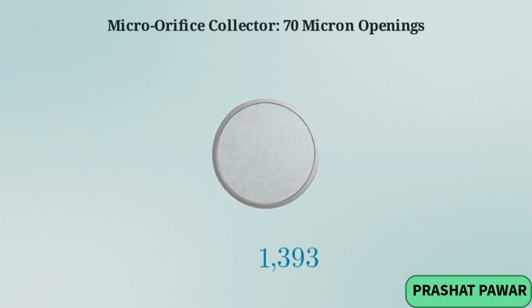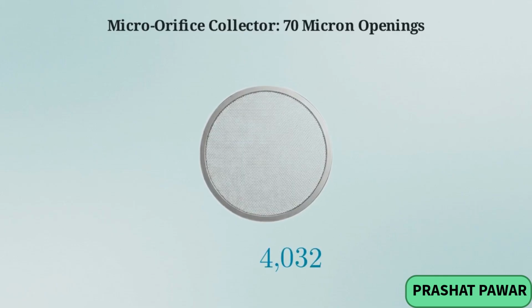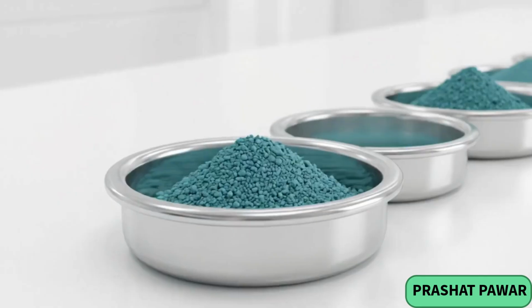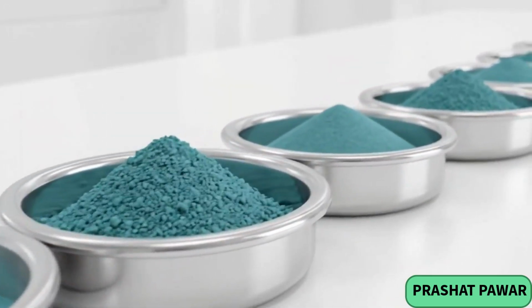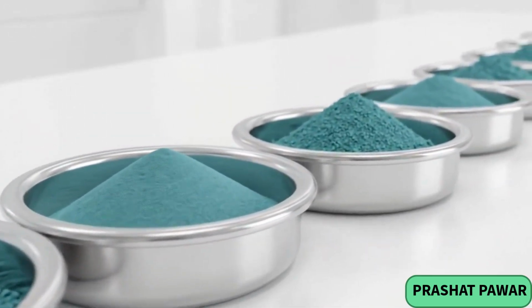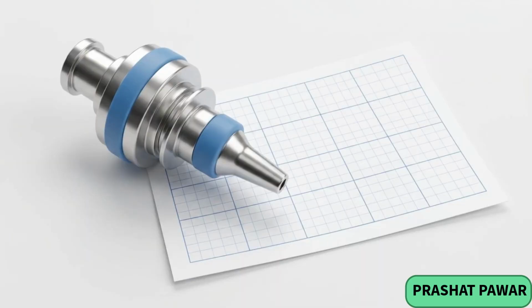The sequence ends at the micro-orifice collector, which acts as a final physical filter, utilizing over 4,000 holes measuring a mere 70 microns across. The result of this engineered matrix is a series of size-fractionated samples, physically distributed across removable collection cups. The impactor hardware does not output aerodynamic data.